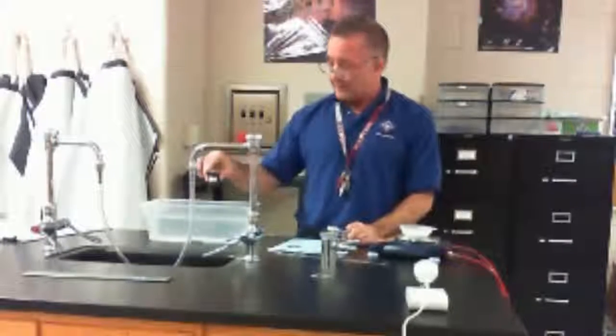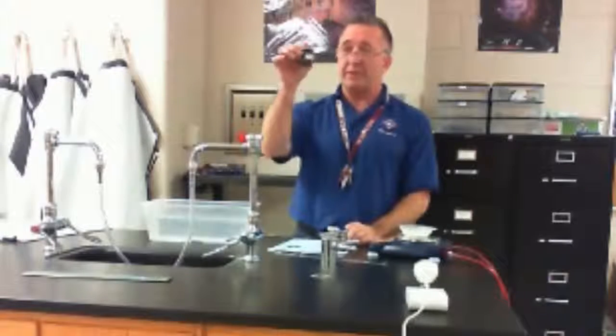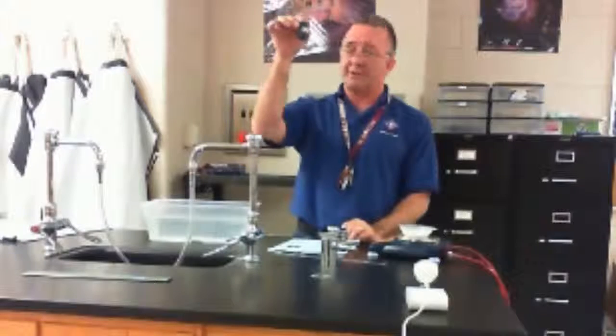Okay, as you do this, you'll see after the first try, people will start getting very, very competitive, and some of them will go back and redo their calculations, and some of them won't want to put theirs in there first, etc. But it becomes a bit of fun after a while, and you get to sit there and watch it, and some of them, again, the ones who are winning will float just at the top.